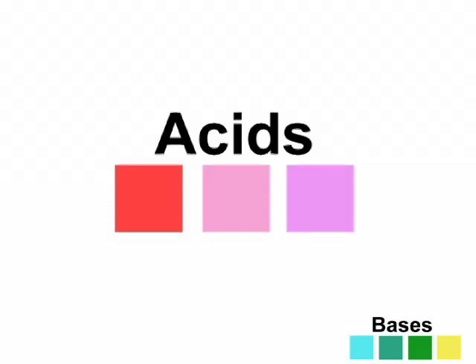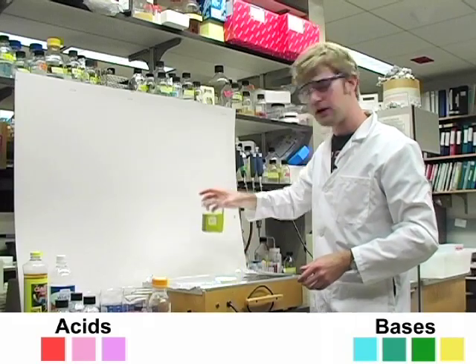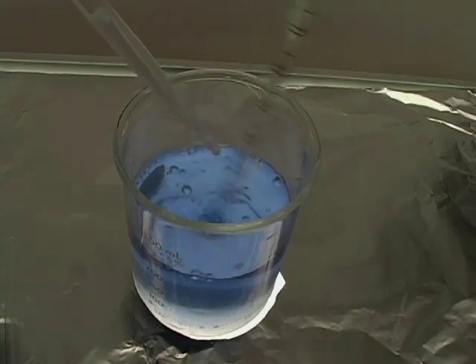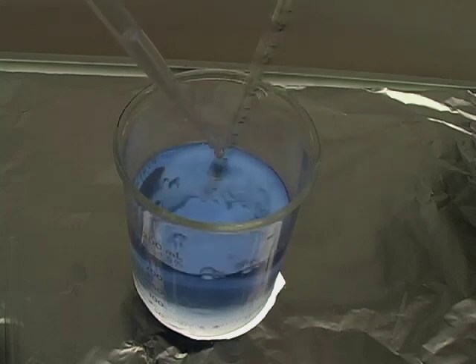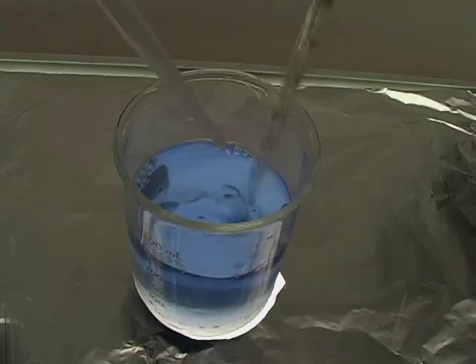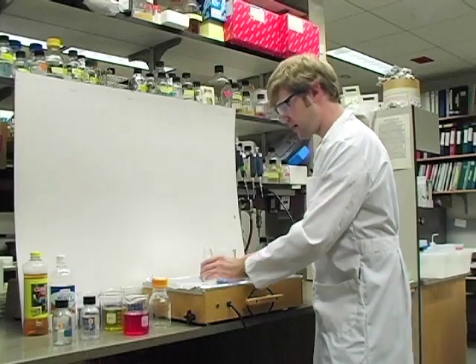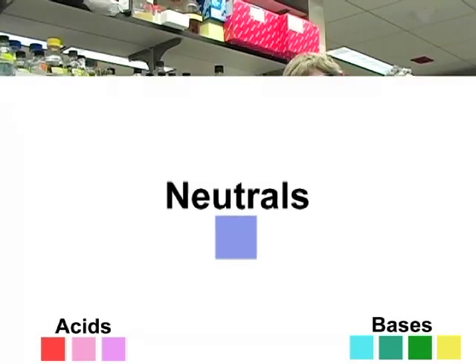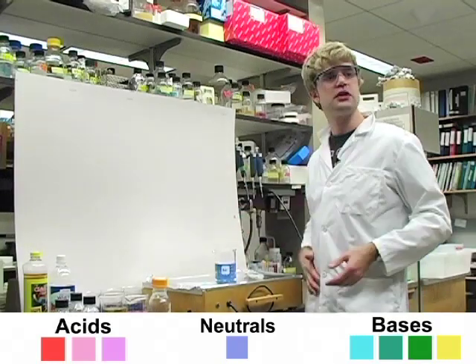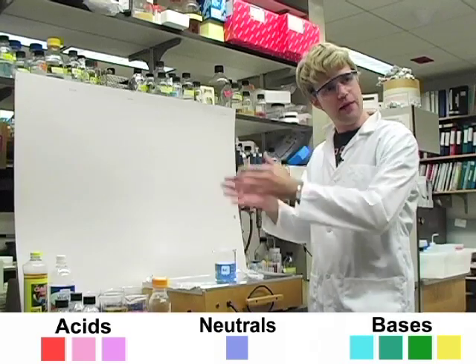So acids make it pink and then red, and bases make it blue, then green, then yellow if we add a whole lot of them. Let's look at another example. I have a third chemical here — dropping in lots of drops — and I'm not really seeing any change. The color remains the same. I can add as much as I want and the color is still going to stay this blue-purplish color. That's because this compound, this chemical, we call it neutral. It's not acid and it's not base, so it doesn't change the color of the indicator. So those are our three categories: acids, bases, and those that are neutral. You can tell whether something is acid, base, or neutral by the color it makes an indicator.